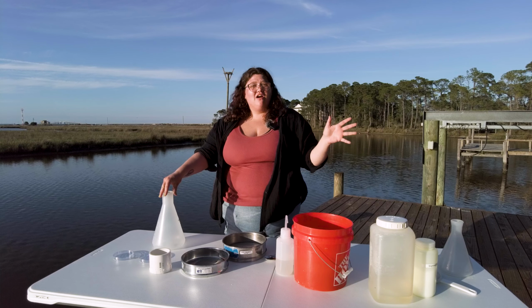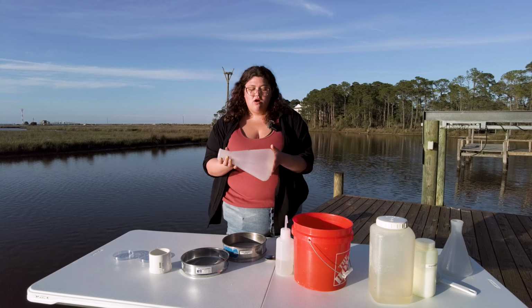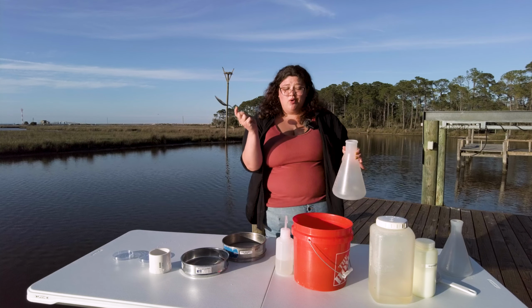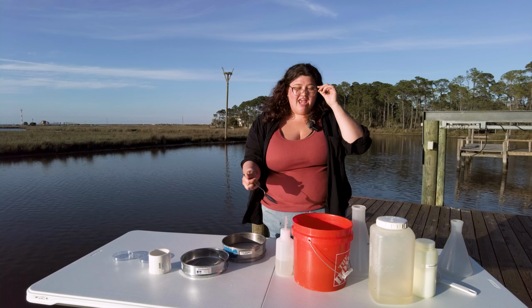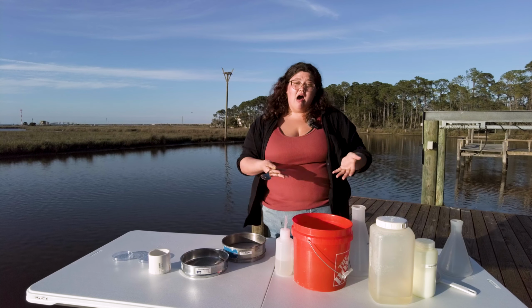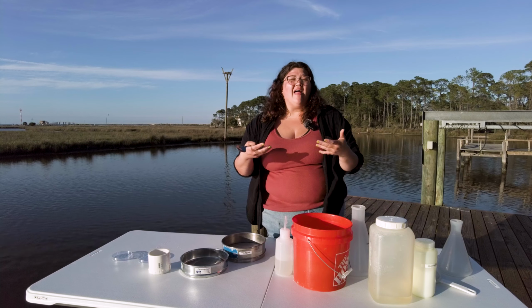All right, so we're gonna start off with our meiofaunal extraction. We're gonna take our flask or any container, our sand, and a good old-fashioned spoon. When you collect meiofauna, you have your sand in your bucket, and if you leave it to sit for a while, the animals will come up throughout the day as the sediment gets more anoxic, meaning lack of oxygen.